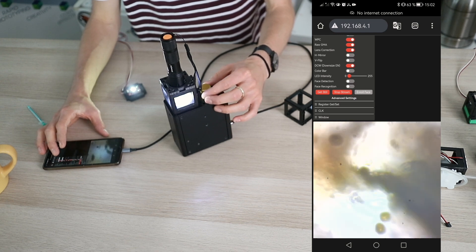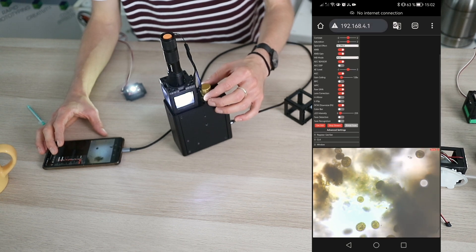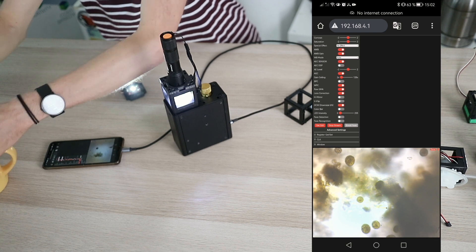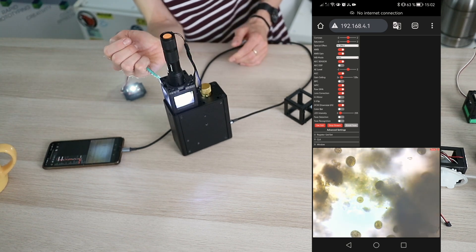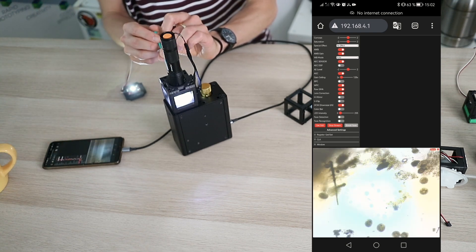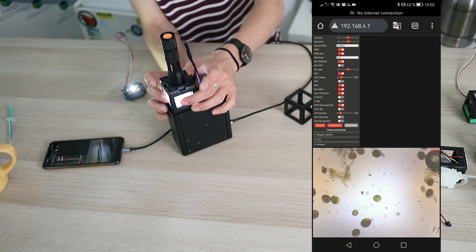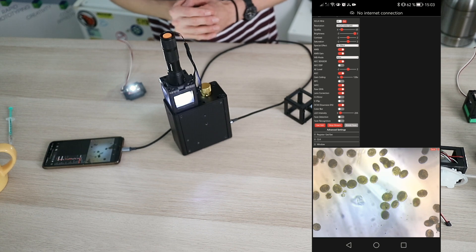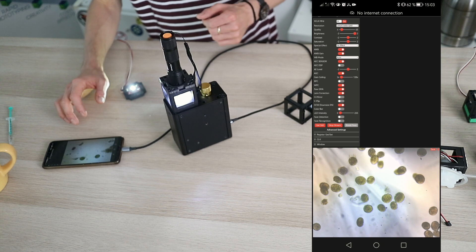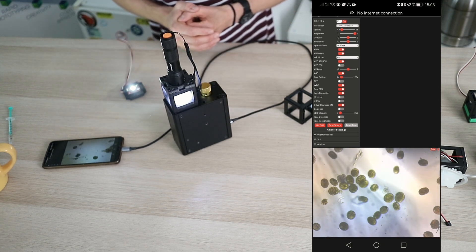We try to find some focus — it's already rather cold here in Germany, we are based in Jena in the center of Germany. So these are some algae. We might need to add some more water so there's less wobble, and if we just wait long enough there will probably be some stuff floating around and crawling and searching for food. You can see how much action there is in the pond water. I'm not enough of a biologist to know what's happening there, but you can see little cilia crawling around, eventually looking for something to eat.